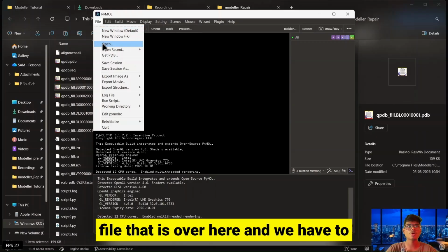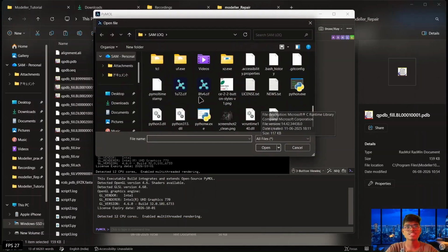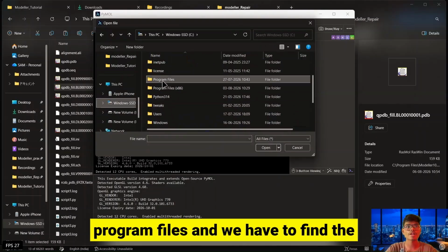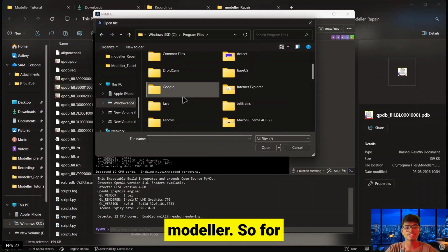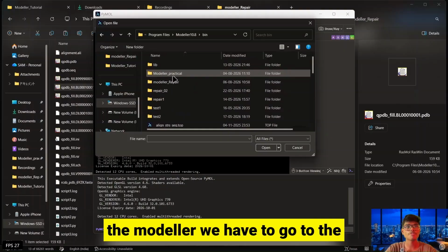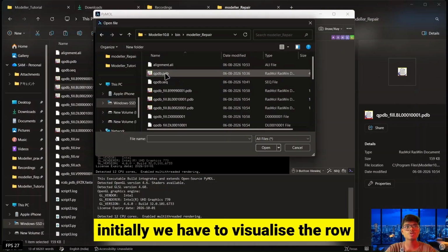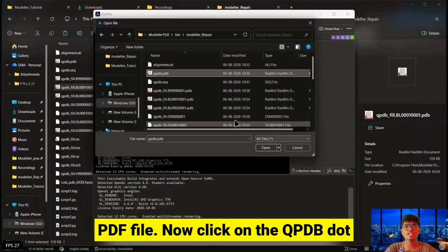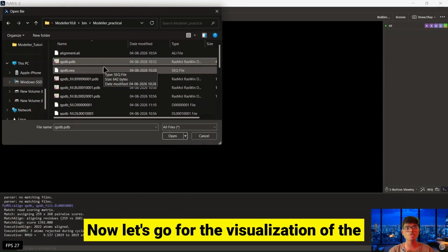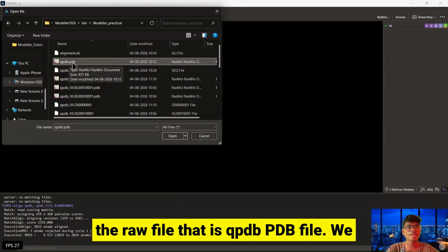Now we have to load the next file. We have to go to drive C, go to program files, and find the modeller. For the modeller, we have to go to the bin folder, and then the modeller repair folder. Initially we have to visualize the raw PDB file. Now click on the qpdb.pdb file. Now let's go for the visualization of the protein structure, the raw file, that is the qpdb.pdb file.